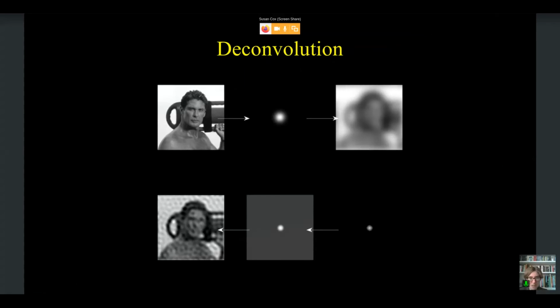I think the German term for it is hammer pattern, and that's obviously very descriptive. It looks like a hammer pattern, and it's at the scale of the point spread function. And this is a very common issue with deconvolution. It's hard to avoid, but it's also something that's worth thinking about when we start to do localization microscopy, that it is very easy to introduce unintended effects when you do any type of fitting.